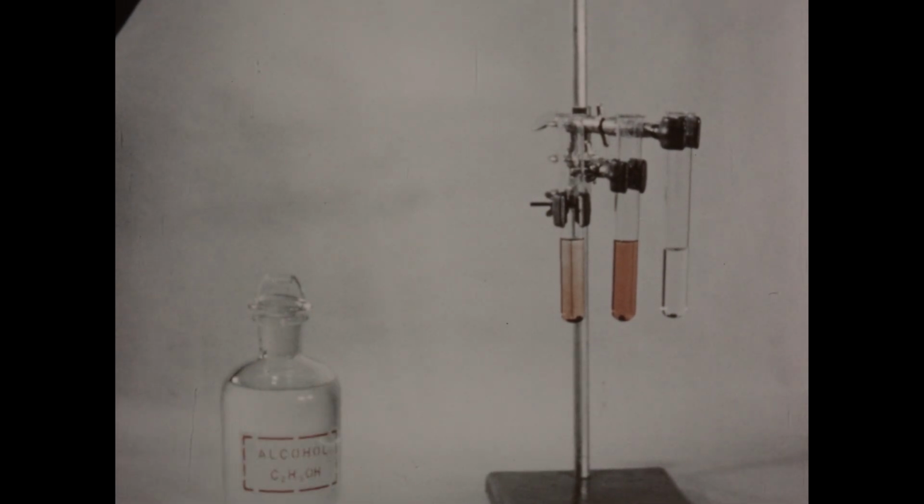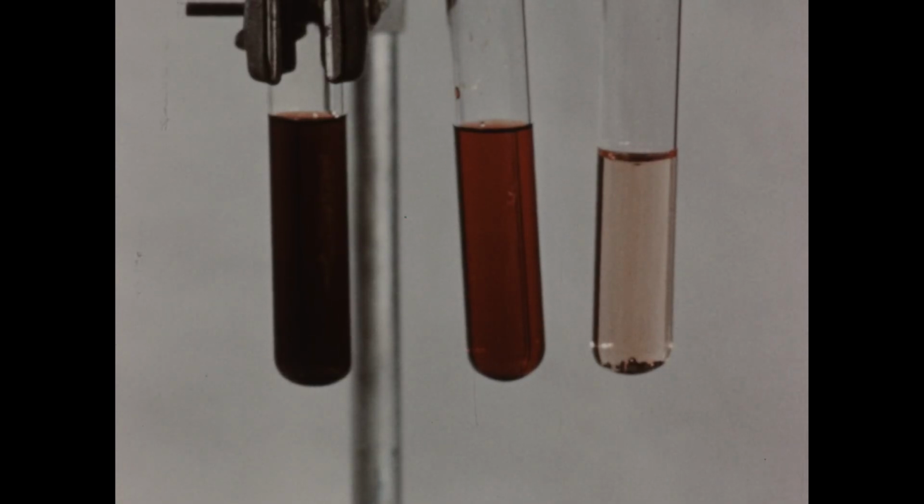We'll now permit the iodine in each tube to dissolve for a few moments. We've stirred each of these mixtures, and you should notice that the tube on the right, in which iodine is in contact with water, has assumed a faint brownish color, indicating that some iodine has gone into solution. But the tube in the middle, containing potassium iodide solution, and the tube on the left, containing alcohol, have both become highly colored. This indicates that iodine is much more soluble in either of these two solvents than it is in pure water.